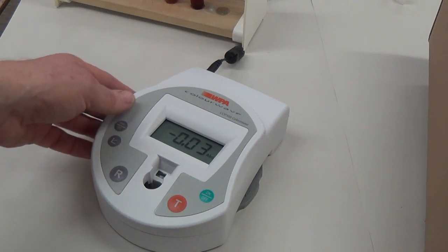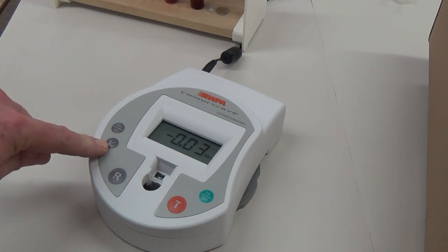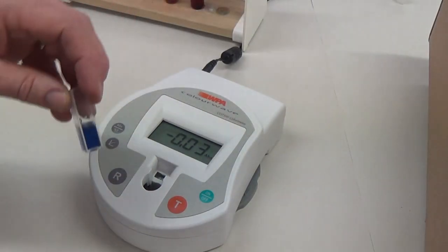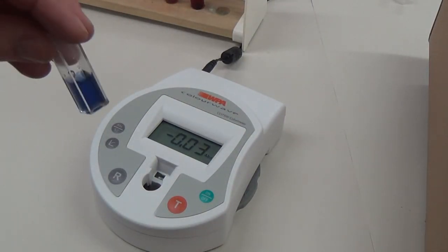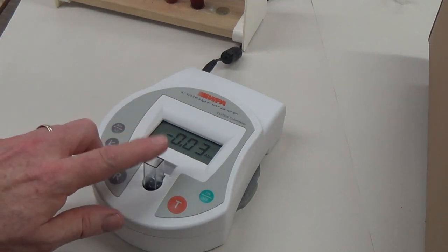This is quite useful because it has a way that you can follow results in real time. For example, if I have a cuvette that contains starch, amylase, and iodine, I can place it in.